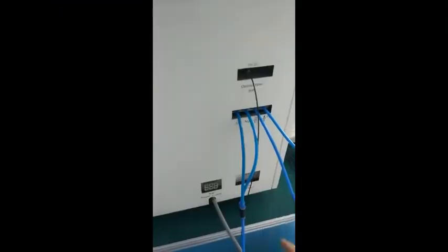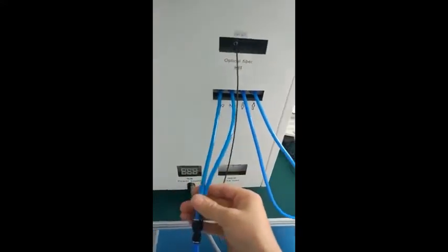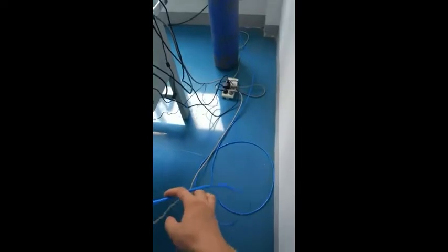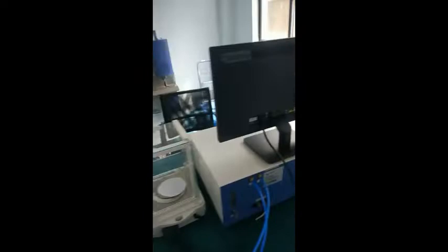There are four blue gas pipes at the back of the machine, and two oxygen pipes on the left are connected to the pressure gate valve of the oxygen cylinder through a T joint.